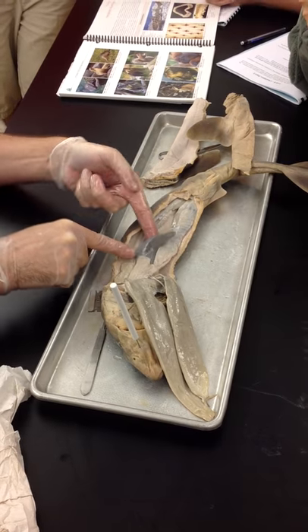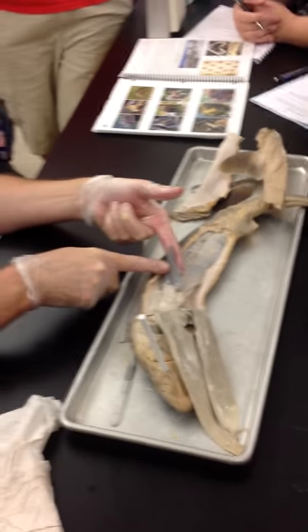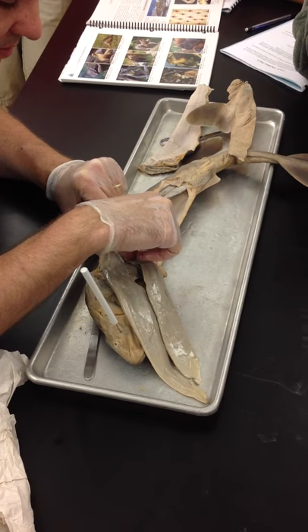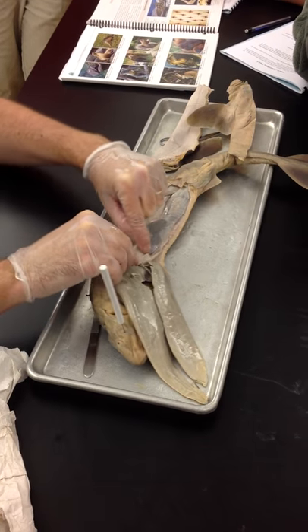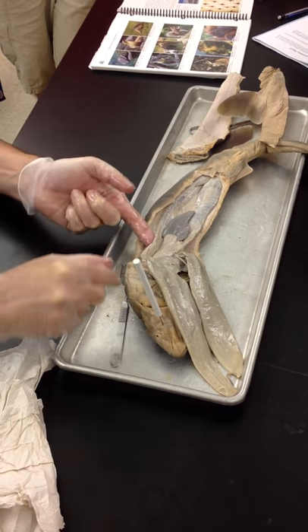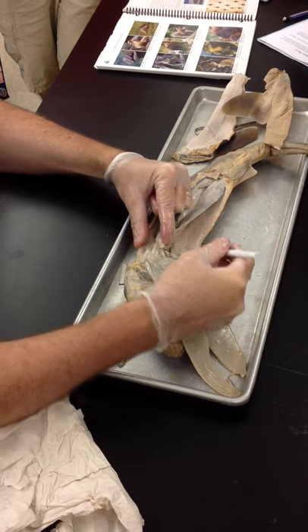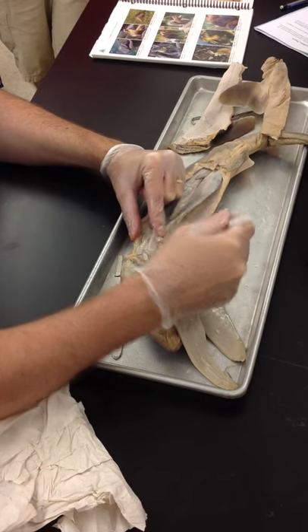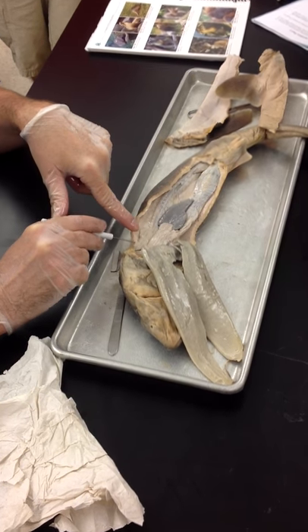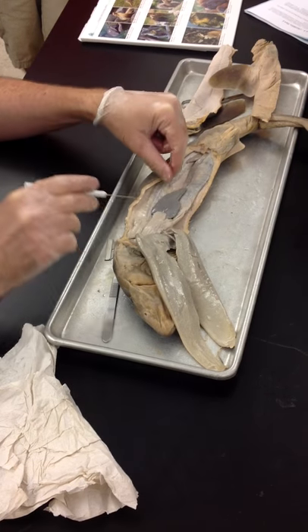This darker gray piece here is the spleen. On either side here — though they're not real well developed — if you lift this piece up, there's a matching one on the other side. That is the testes. So, paired testes on either side.